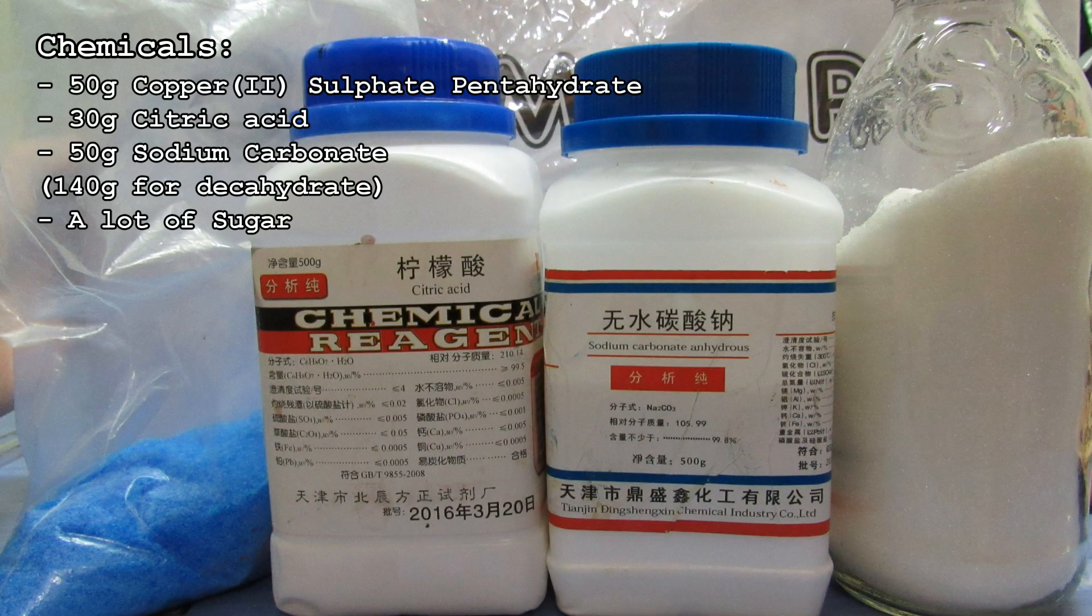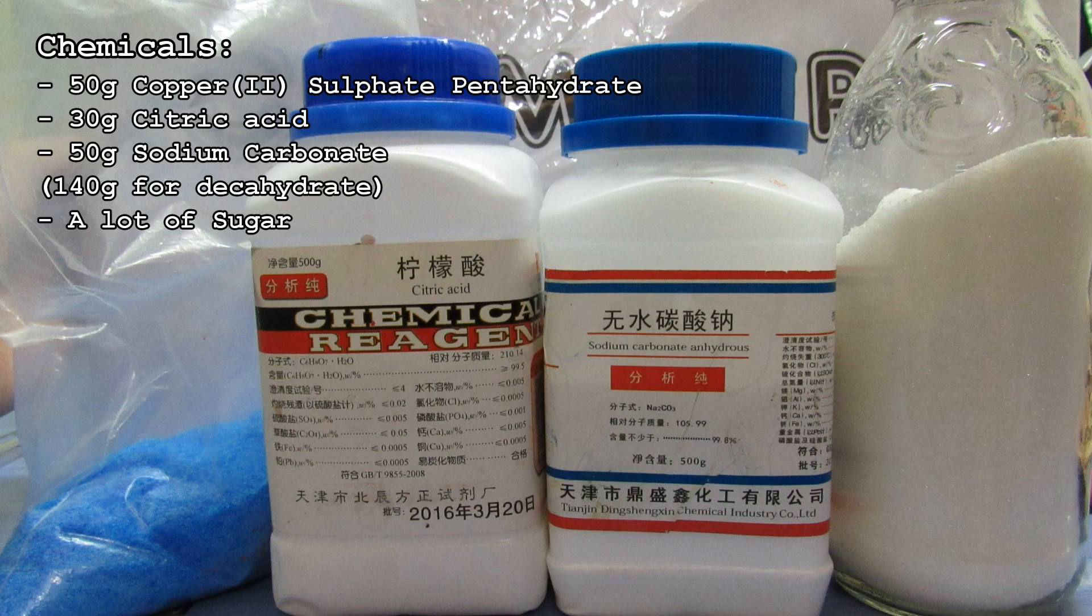Here are all the ingredients I used, from left to right. We have copper-2-sulfate, citric acid, sodium carbonate, and some regular white sugar.